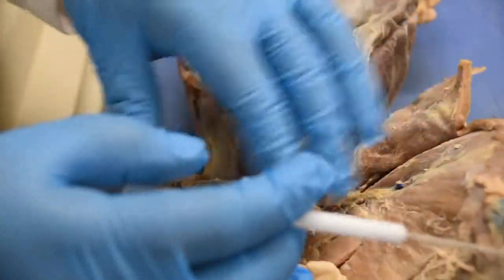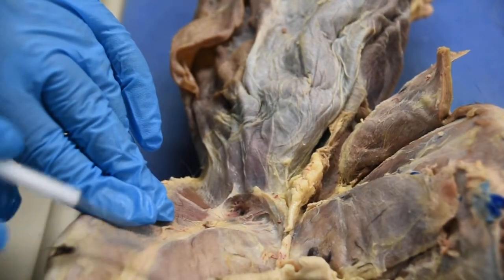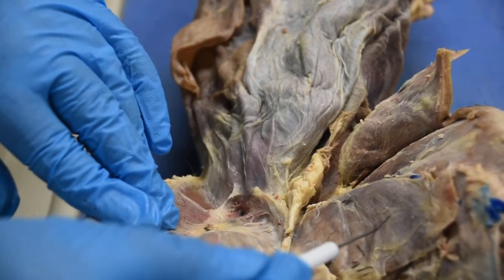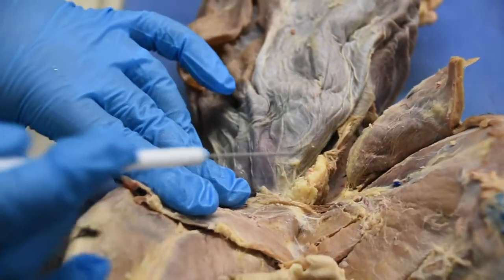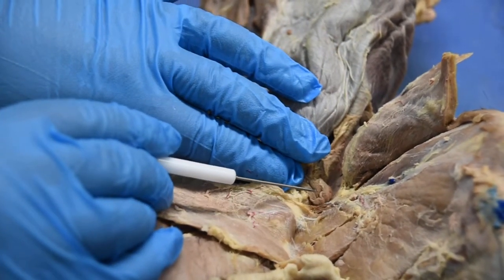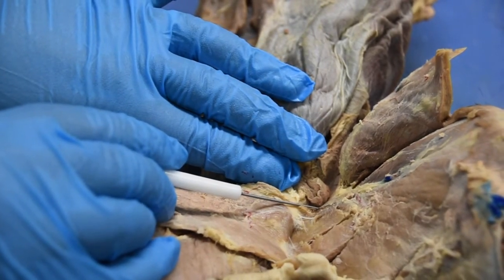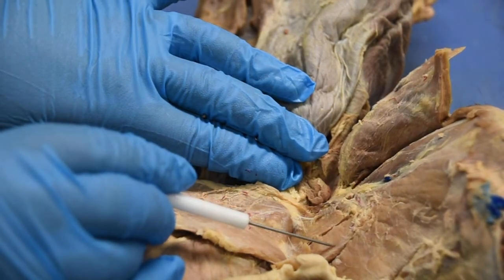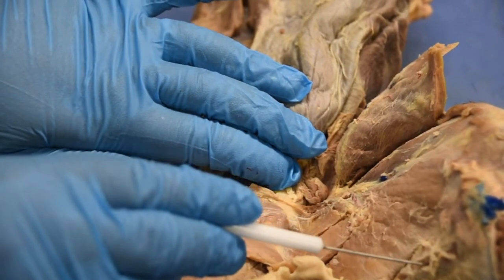So let's look at what is underneath my gracilis. Again, gracilis is this muscle right here. On this side, we're going to look at the deep muscles. If I retract this one, what would you see right underneath it? The muscles you can visualize here are your pectineus on the corner, adductor longus, adductor magnus, semimembranosus, and semitendinosus.